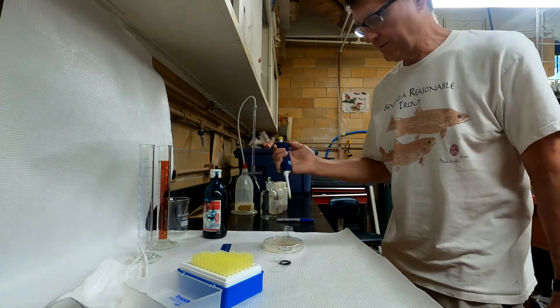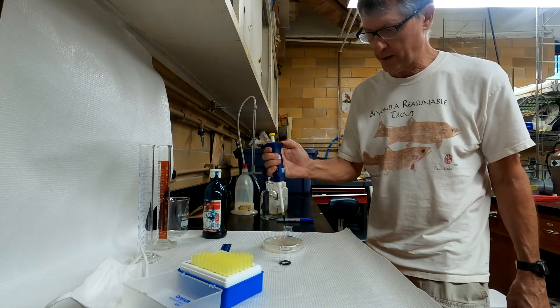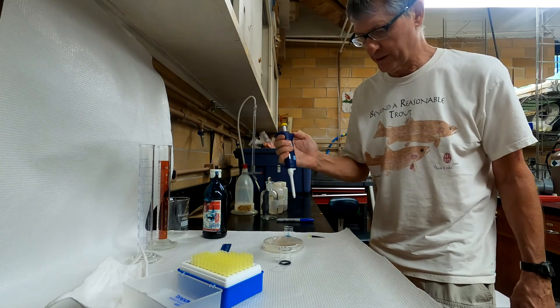When you want to discard your tip, you just push down on this outer button, and it pushes the tip off.